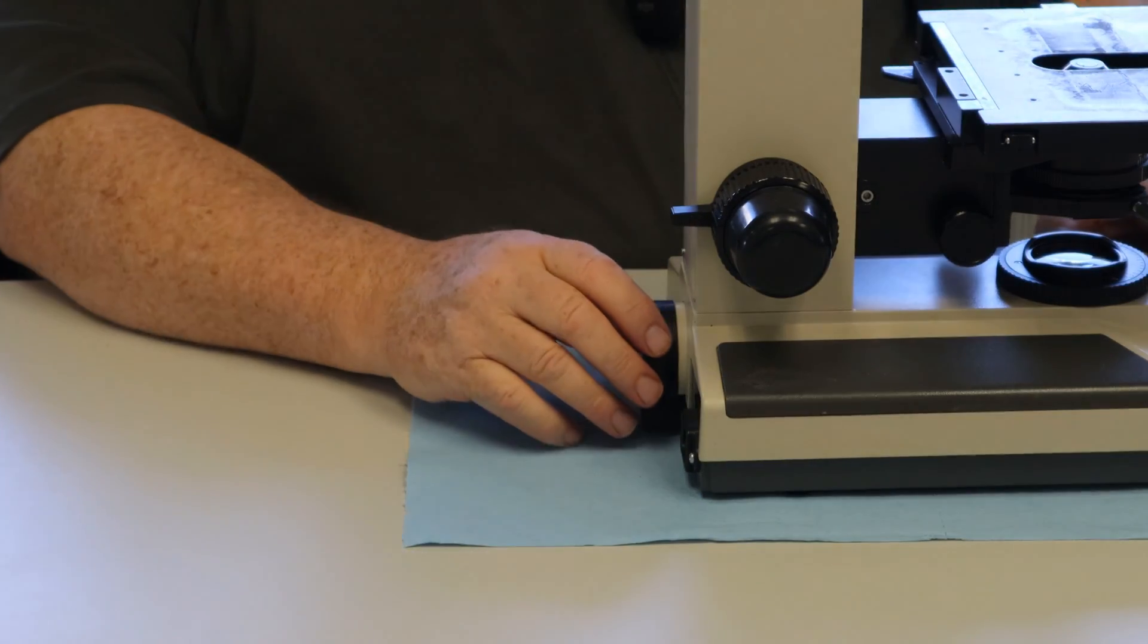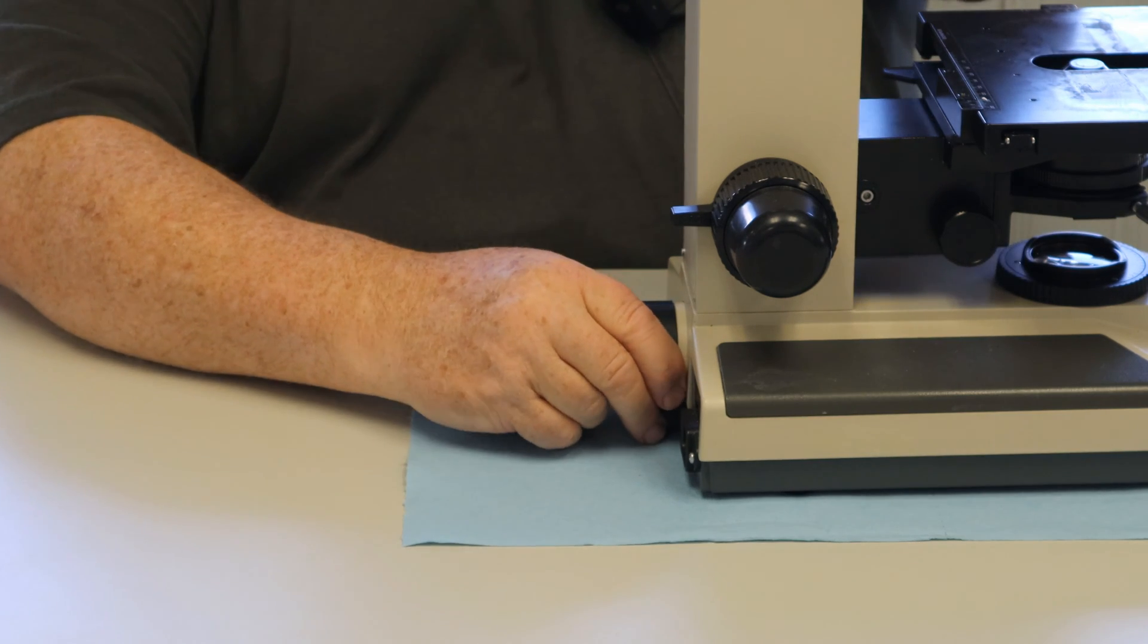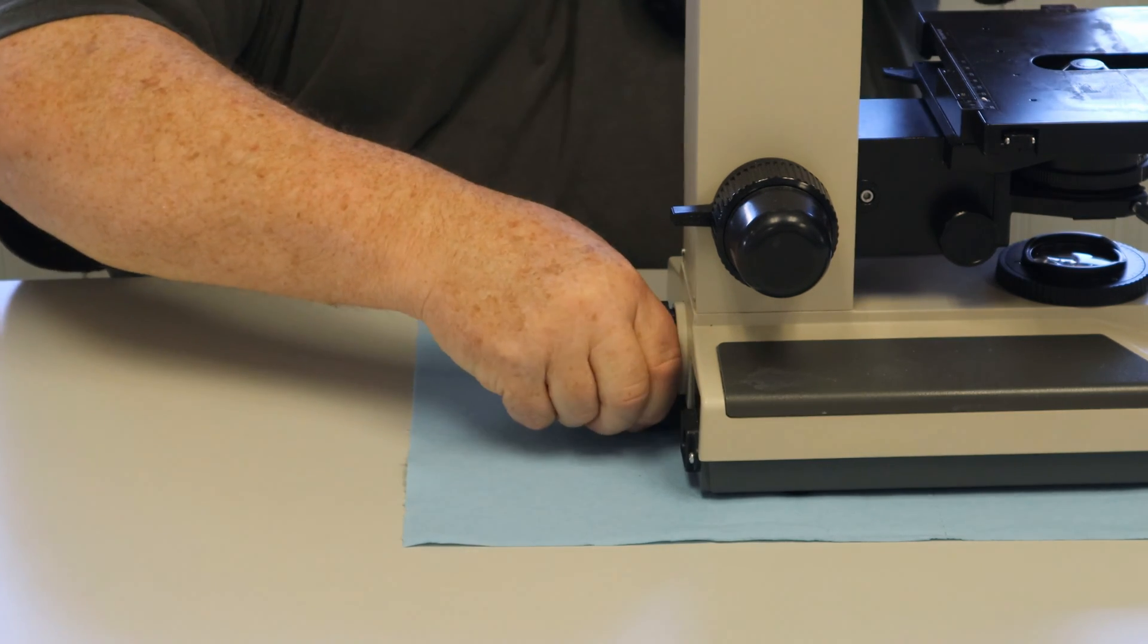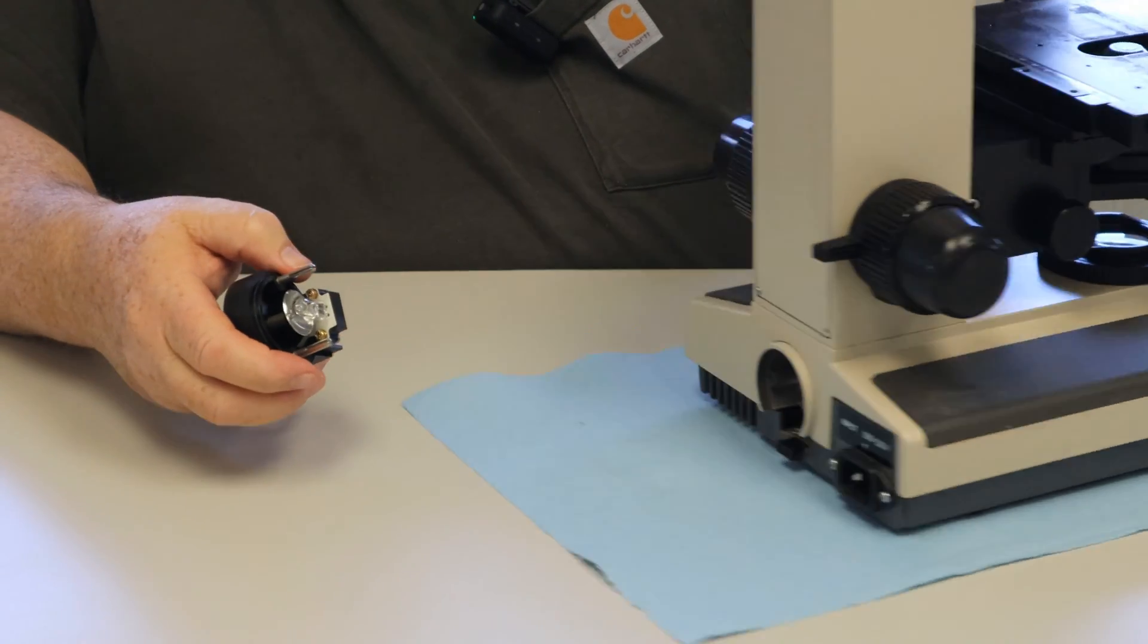This BHTU has the light bulb that comes in and out from the back. It has a simple lamp socket, comes out two pins to line it up.